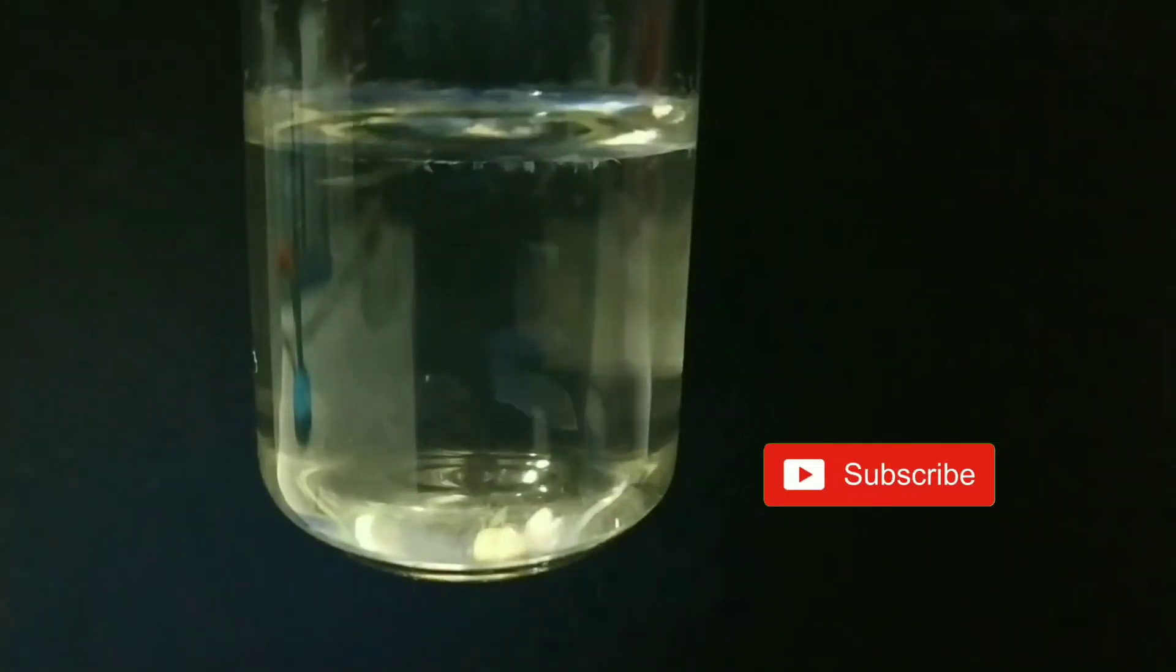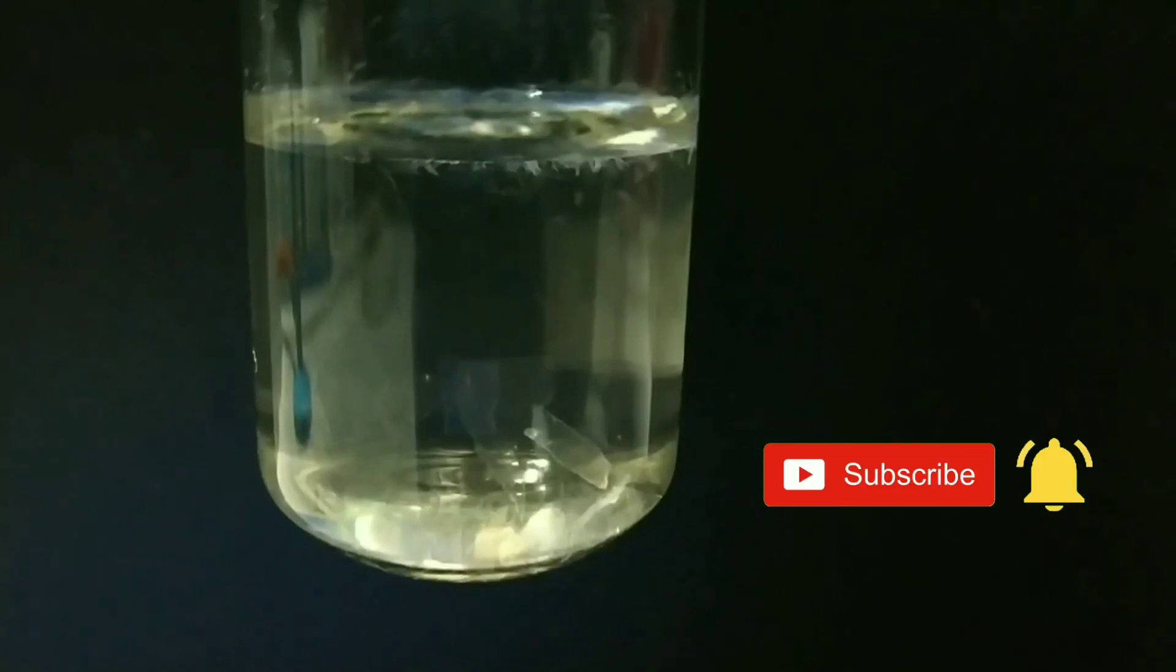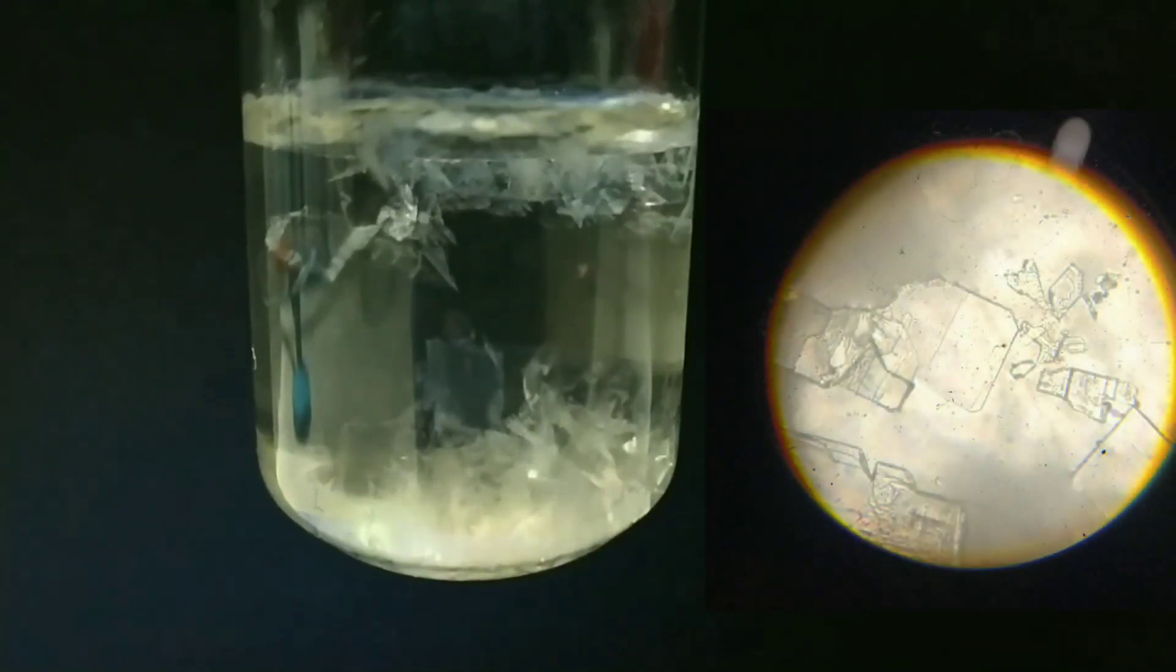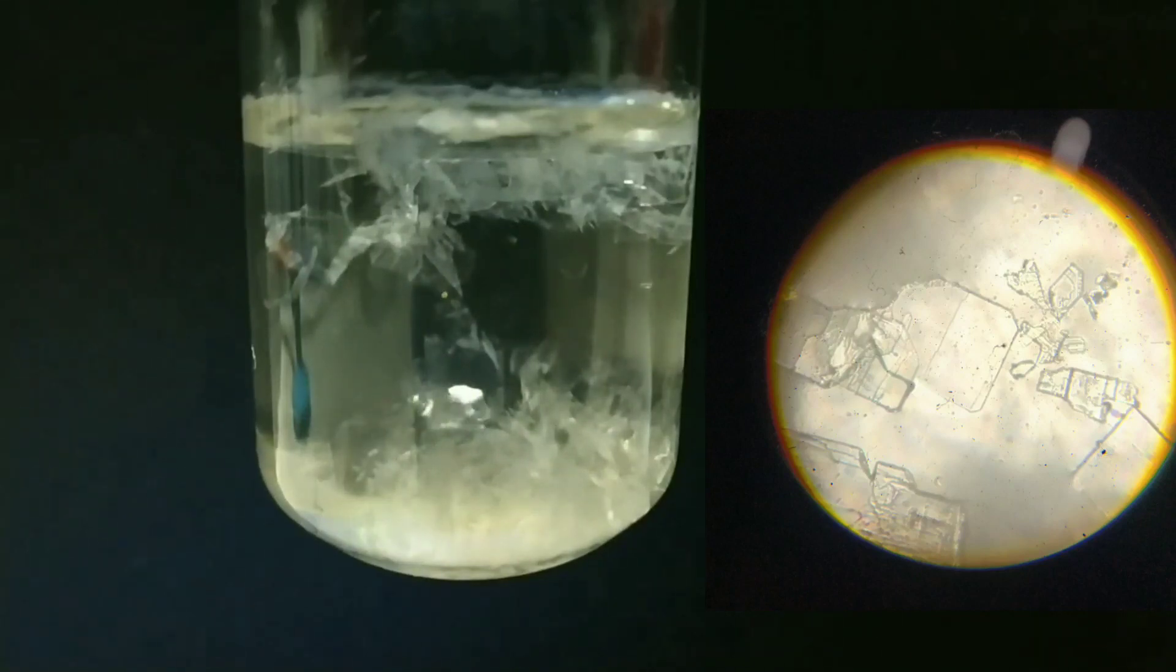In this clip, you are seeing the crystallization of acetanilide. You can see those flake shaped or the sheet shaped crystals of acetanilide being formed. The image you see on the right side is the microscopic crystals of acetanilide which has the sheet shape arrangement.